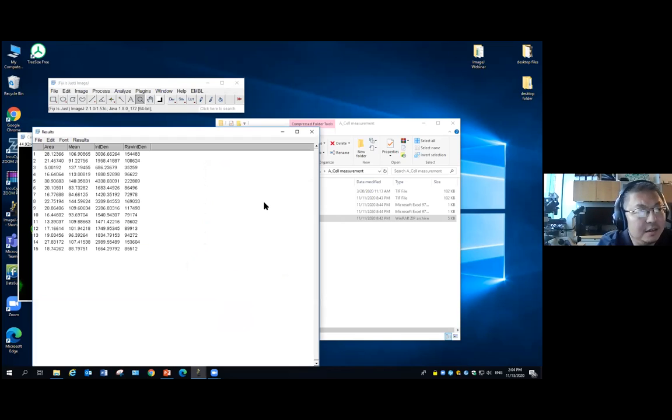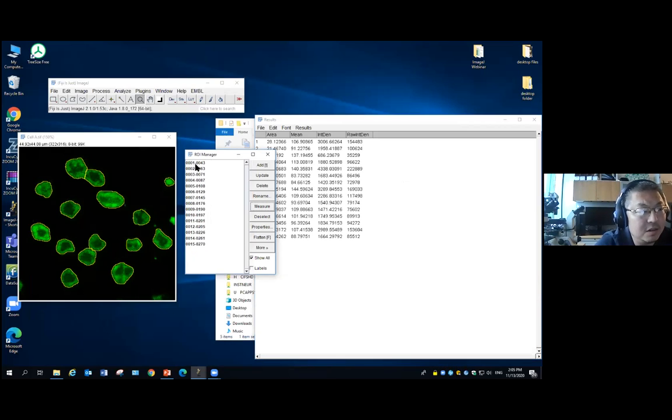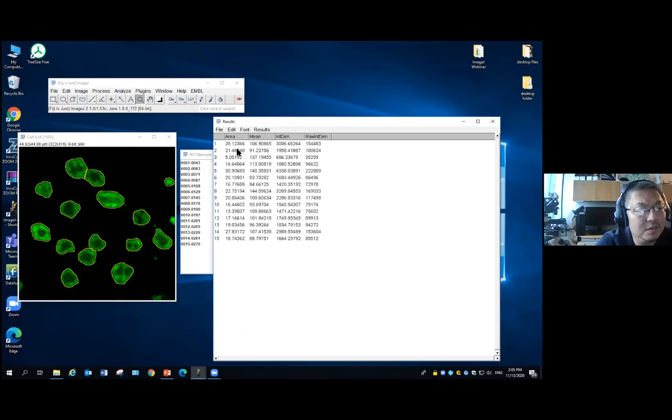I click on this to give me the Results window. As you can see, we have the index of 1 to 15. That corresponds to the index of the cell inside your ROI Manager. And this is the size, the mean intensity, and the total intensity. There are 2 values; we'll talk about those a little bit later.